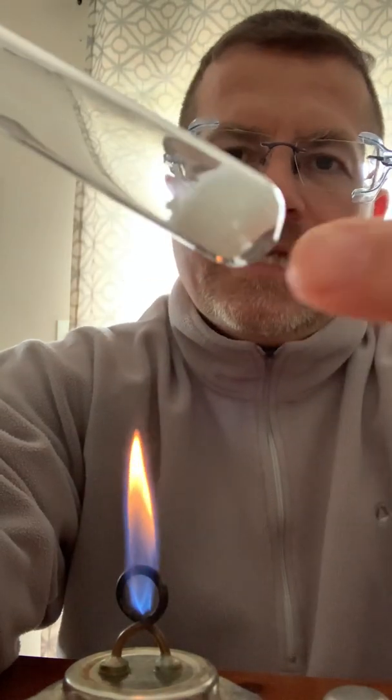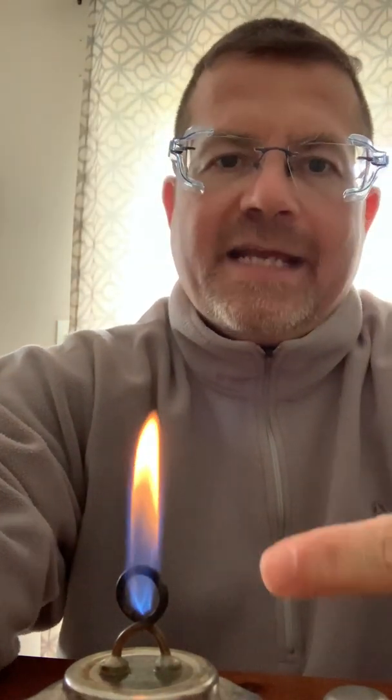All you need to do for this to start is you need to take and put this potassium chlorate in a flame. And when you do that, you add heat to the reaction. By the way, we've been talking about endothermic and exothermic reactions in my class. If I'm adding heat to it to get it to decompose, is that endothermic or exothermic? Pause the video if you need to.